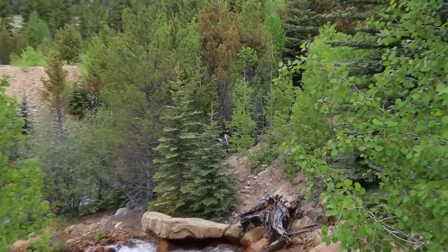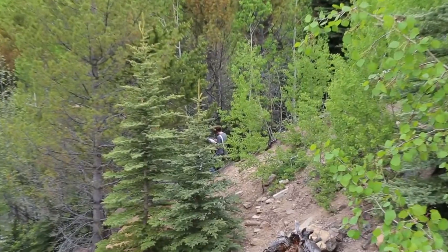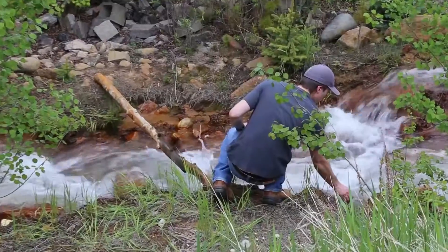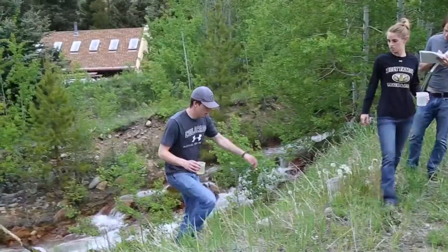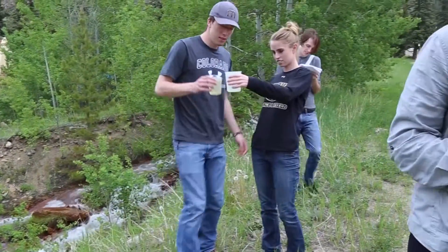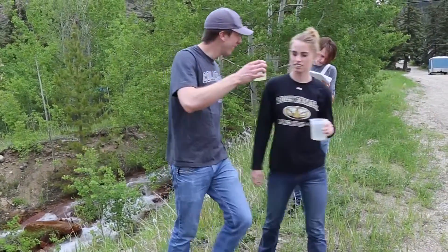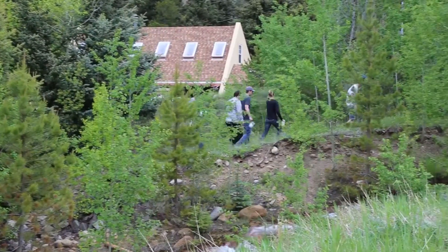Today we're collecting water samples. We want to see how metals move in the environment and what impacts they have. They're collecting samples that will tell them what metals tend to move throughout the environment and which ones may stick to sediments or not be transported.